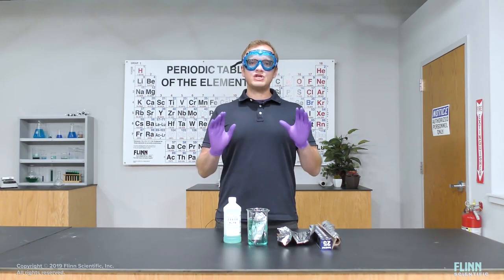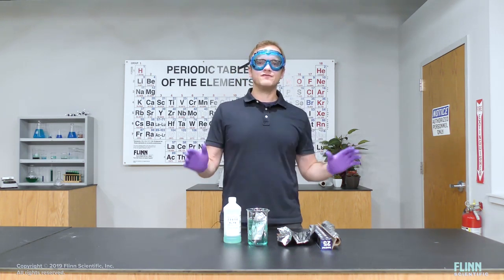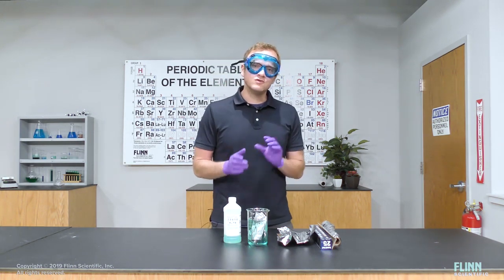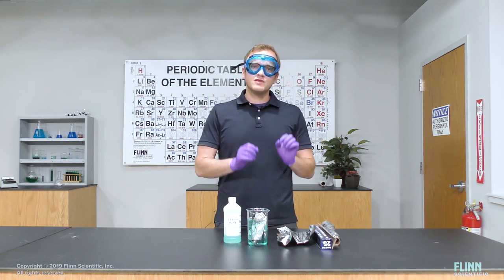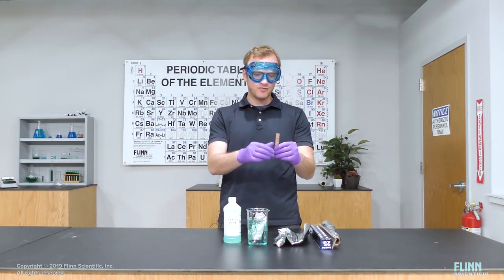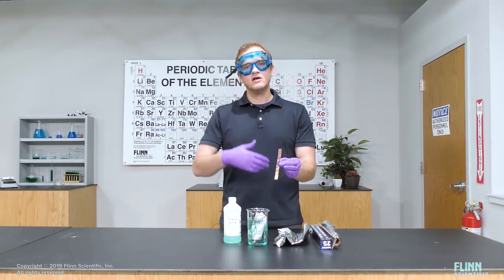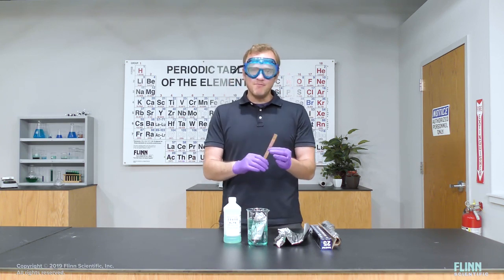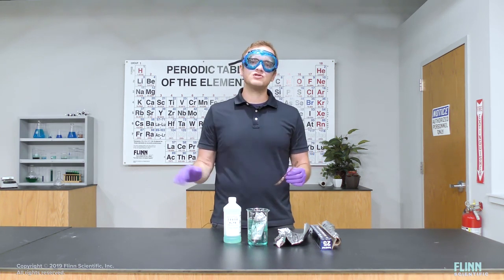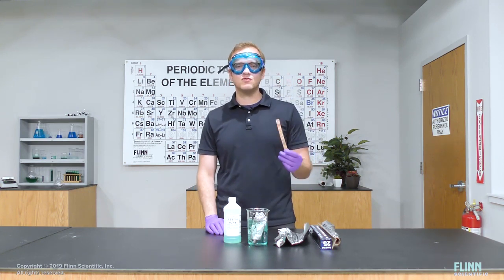Now, if you just got done with your challenge on choosing the best metal for a school bus, let's talk about some things you may have seen, depending on how you set up your experiment and how you decided to test these different metals. What we did is we tested these metals, tested their reactivities in a variety of solutions. So, for example, here's a strip of copper. We tested whether copper reacted with copper chloride, iron sulfate, aluminum nitrate, and some other solutions. The metal that we saw that didn't have any reactions, it didn't react in any of the solutions, was copper. And so we decided to choose that as our metal of choice for school bus construction.